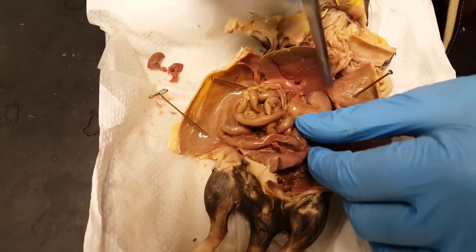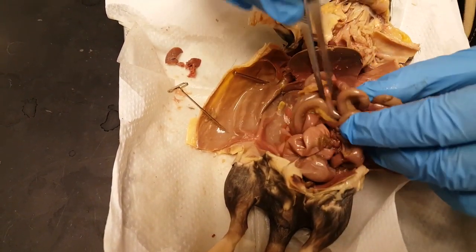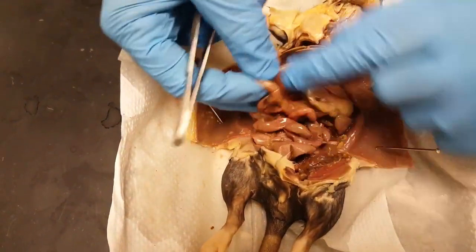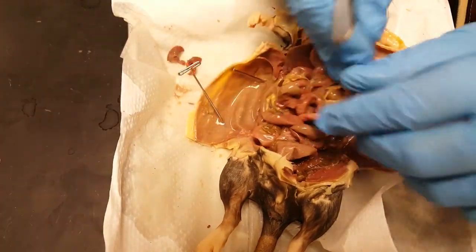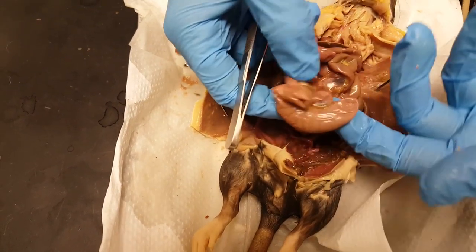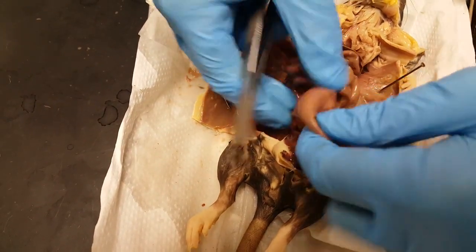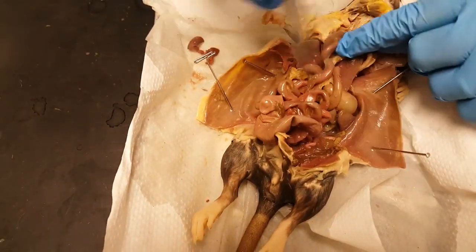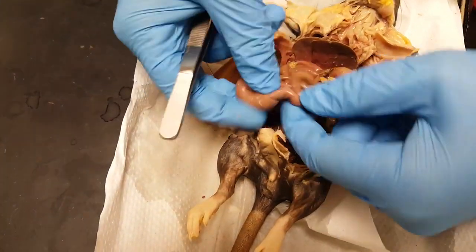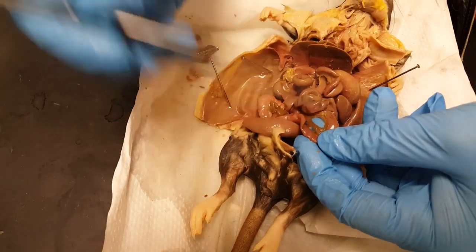Going back to the stomach, we're going to follow it down. This is the duodenum, and then when you get to this curly stuff, this is the jejunum. If you stretch it out, you can see the mesentery and the mesenteric arteries in that jejunum. You follow that all the way down — it's very long — and in the rat you get to this pouch. This is the cecum. Humans have an appendix there. The small intestine starts at the duodenum, goes to the jejunum, and then its last little stretch, where it enters into the cecum, is the ileum. So it goes: duodenum, jejunum, ileum.